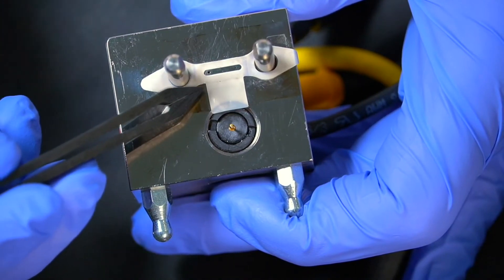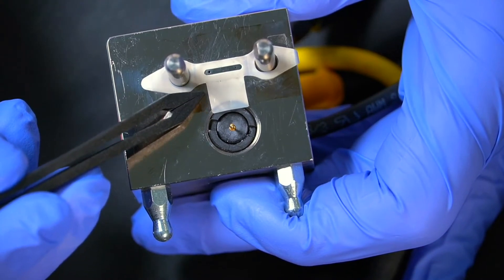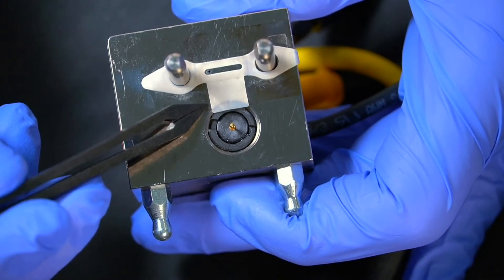The thing you should look out for, though, is if you start to see any signs of salts crystallizing around the gasket there. That's a sign things should definitely be cleaned up and a new gasket fitted because that's a sign of leakage.